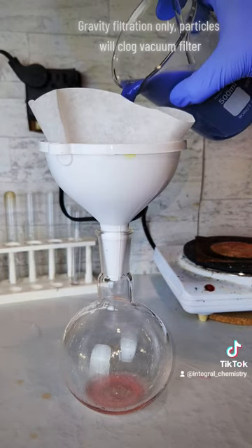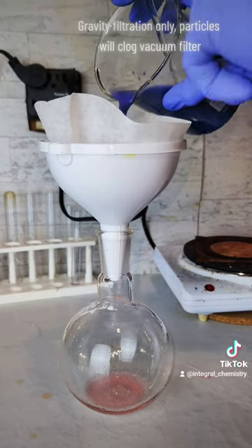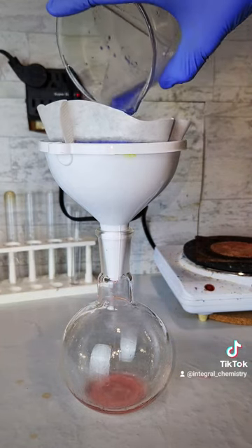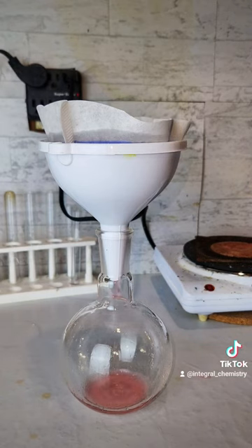In any case, at this point I add my solution to a coffee filter to get rid of the remaining cobalt nitrate. I didn't show it on camera, but I did several rinsings with hydrochloric acid to dissolve the cobalt hydroxide.